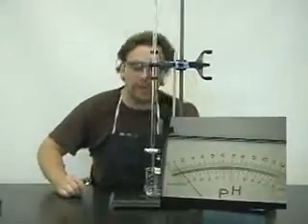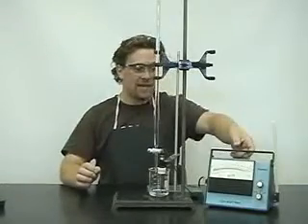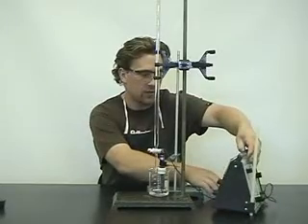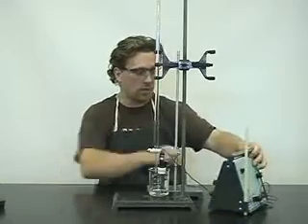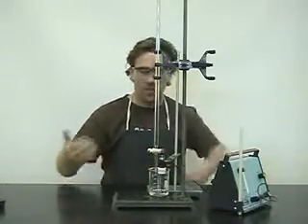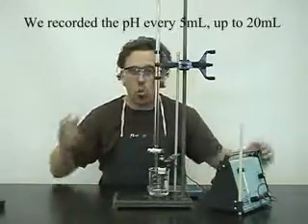Now, what we'll do is we'll add five mils of sodium hydroxide at a time. Now I'm just going to turn this over so I can see it and do the readings. Now every five mils, we're going to record the pH. Now because this is going to take a whole bunch of time, and I don't want to spend too much time, because the procedure is quite simple.